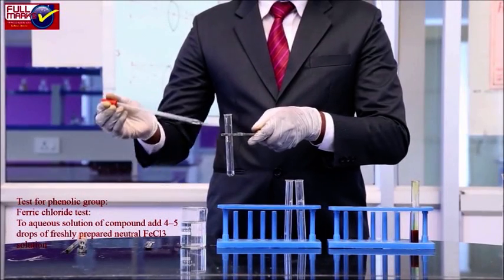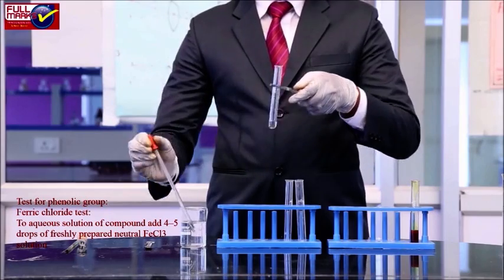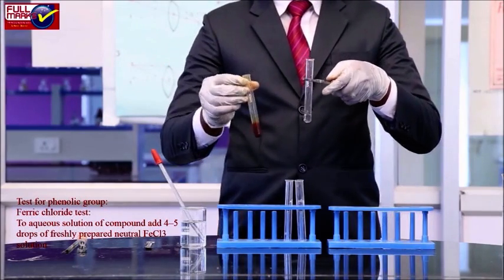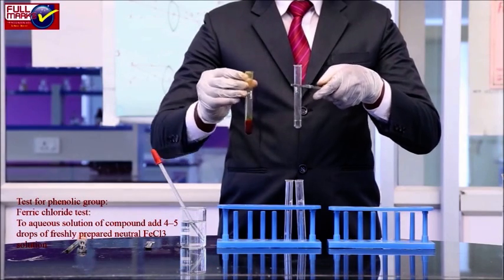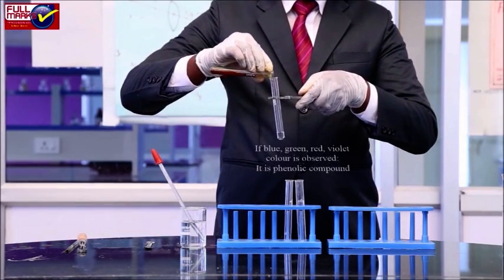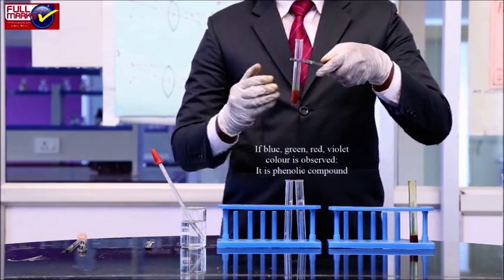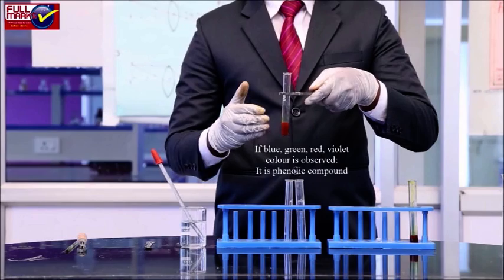Test for phenolic group. Ferric chloride test. To an aqueous solution of the compound, add 4 to 5 drops of freshly prepared neutral FeCl3 solution. If we observe blue, green, red, or violet color, it is a phenolic compound.